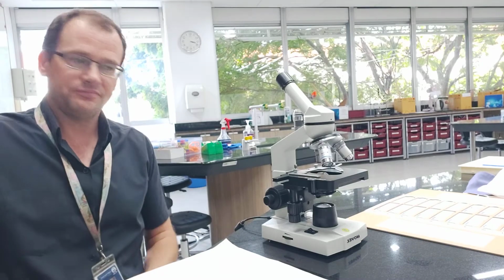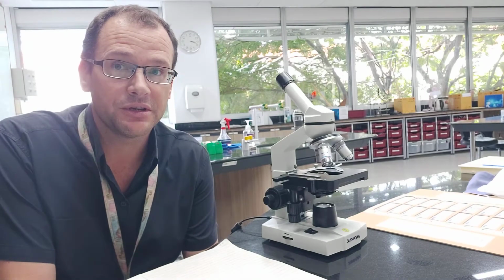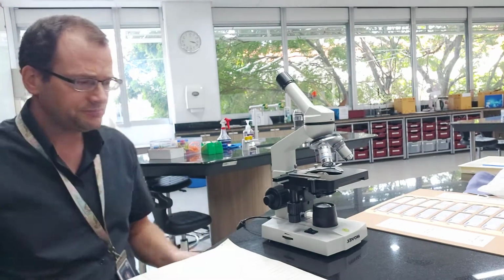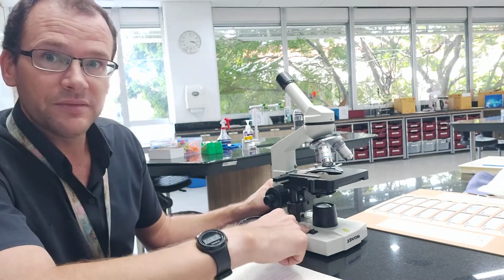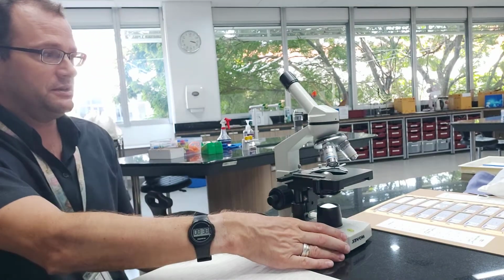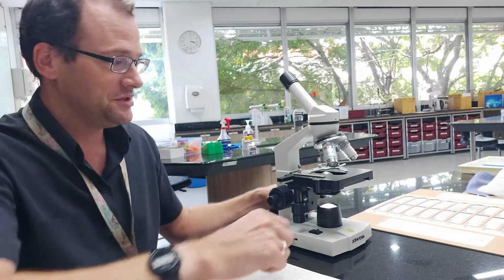All right, so what we'll start with, you come with a plug and a lead, you should have. On the diagram that you get, there's a mirror at the bottom. So the mirror is for reflecting a light source. These microscopes have got an electronic light source. I'm going to plug this in and turn the light on. So you can see here, there's a little dial that turns the light on and off. Temperamental, okay, the plug was a bit temperamental, so that's why it wasn't turning on.